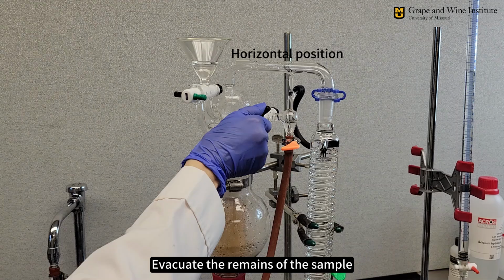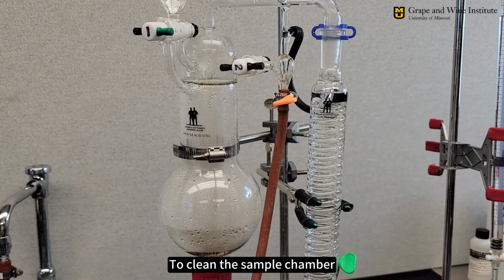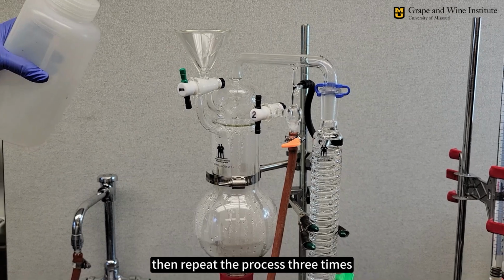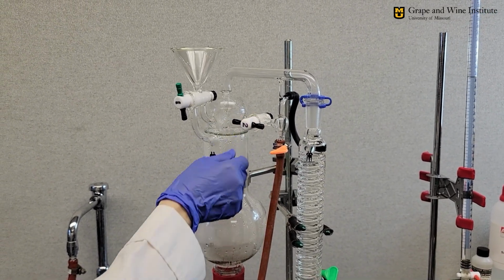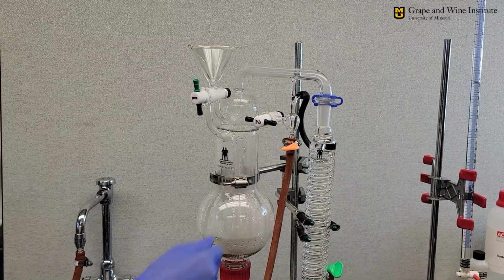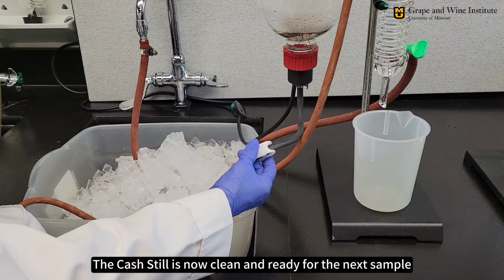Evacuate the remains of the sample. Turn the stopcock to the horizontal position, allowing the sample to drain through the hose into the sink. To clean the sample chamber, turn the stopcock to the vertical position and add distilled water. Let it drain, then repeat the process 3 times. The Cash still is now clean and ready for the next sample.